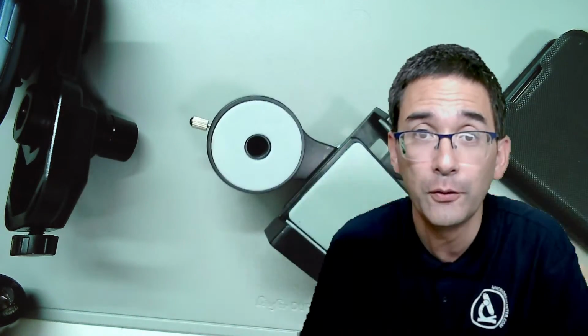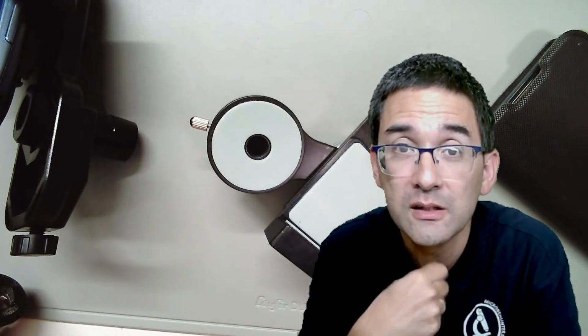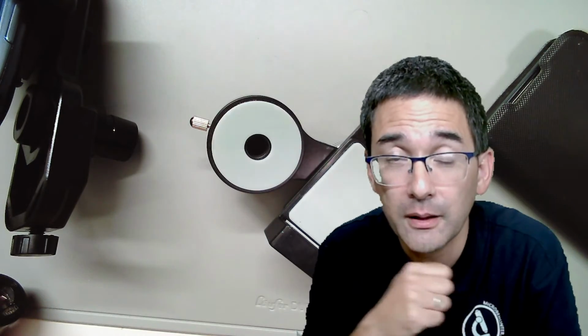A big advantage of mobile phones, of course, is that it allows you to do video, because the mobile phone does the storing of the film, so you don't have to transfer anything over USB. But it is also possible to use the mobile phone like a webcam, so that you connect it over Wi-Fi or over a USB cable to the computer, and then you can see the image that you picked up with the mobile phone on the computer screen. You need to install an app and a program on the computer, and then you can use your mobile phone like a webcam.